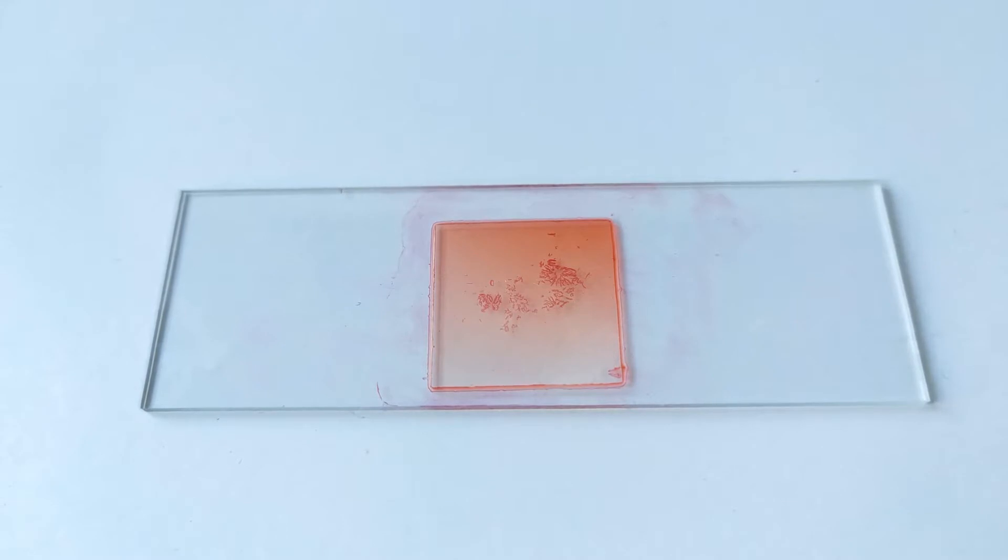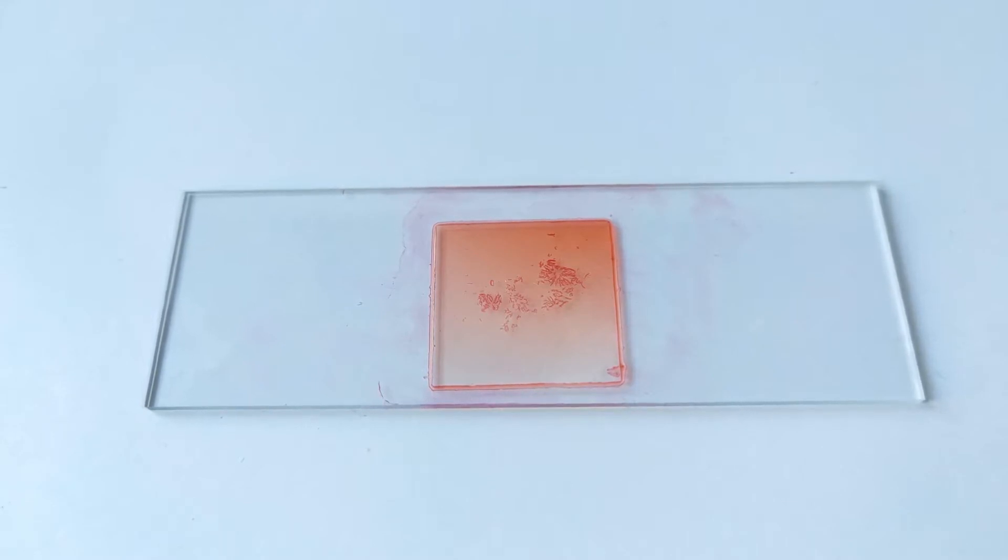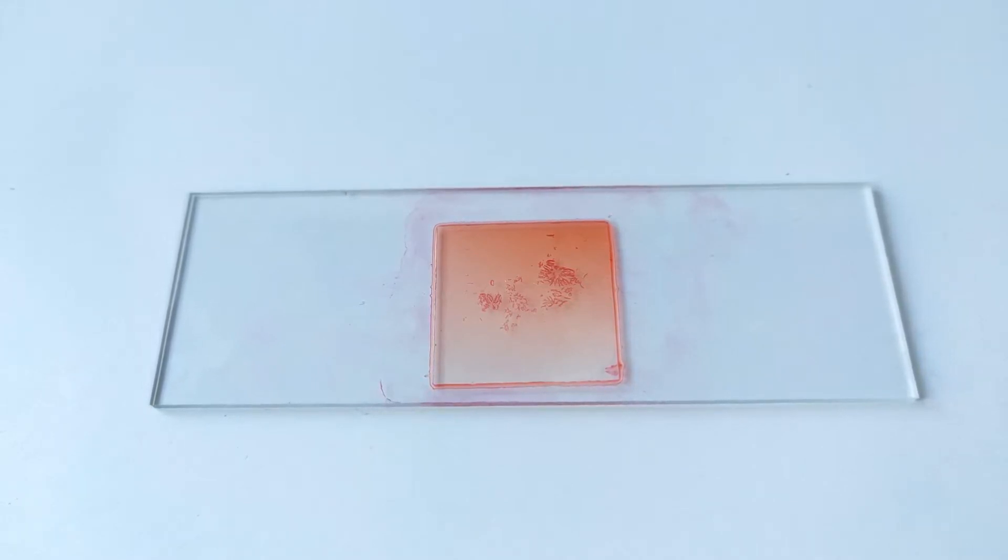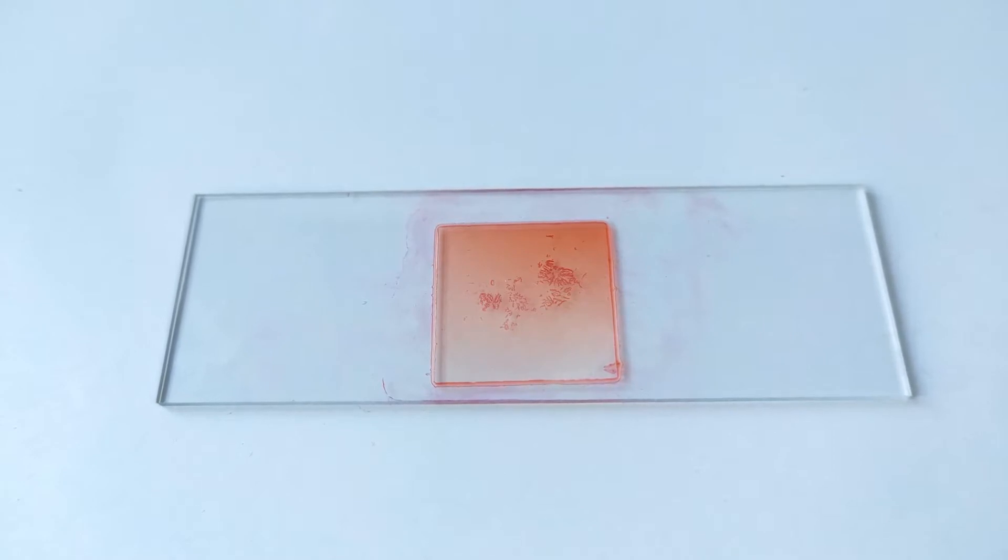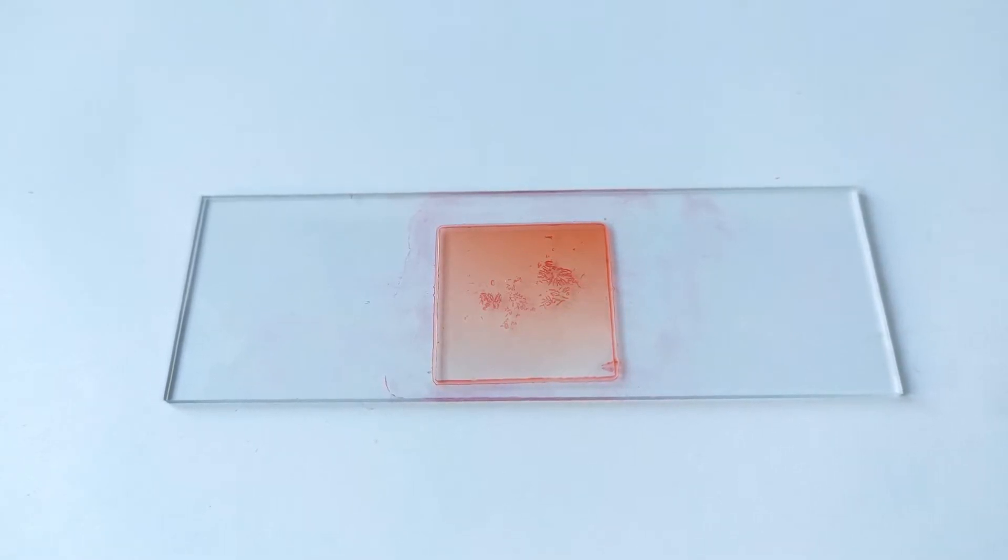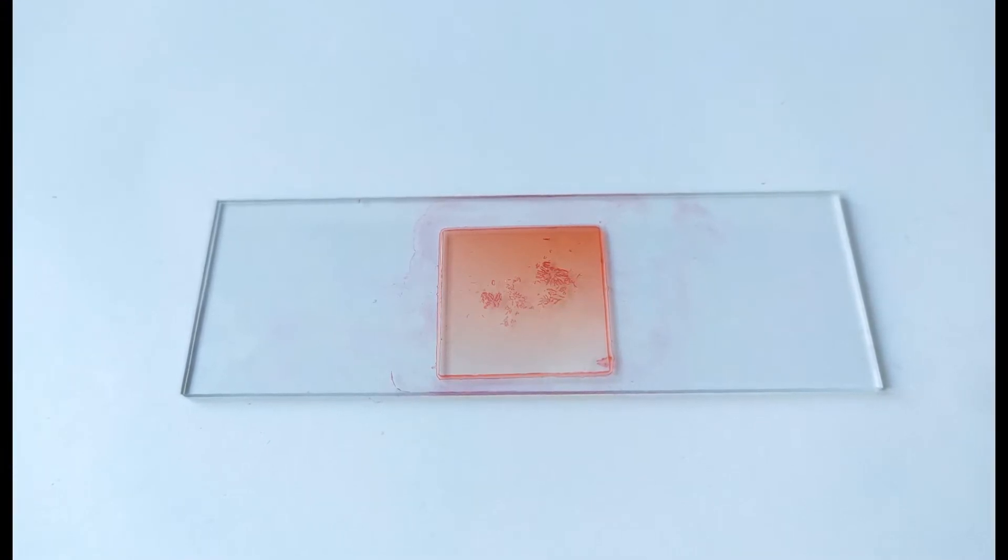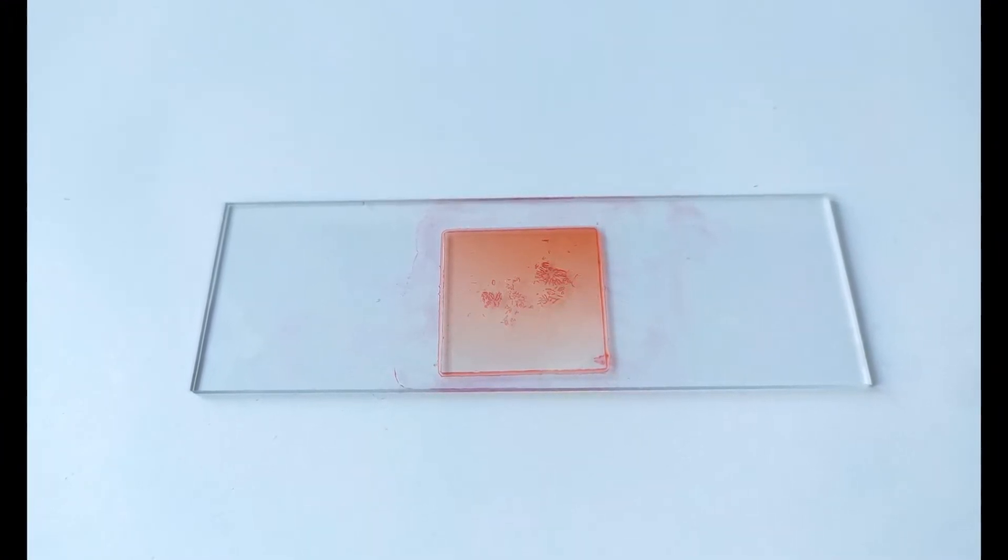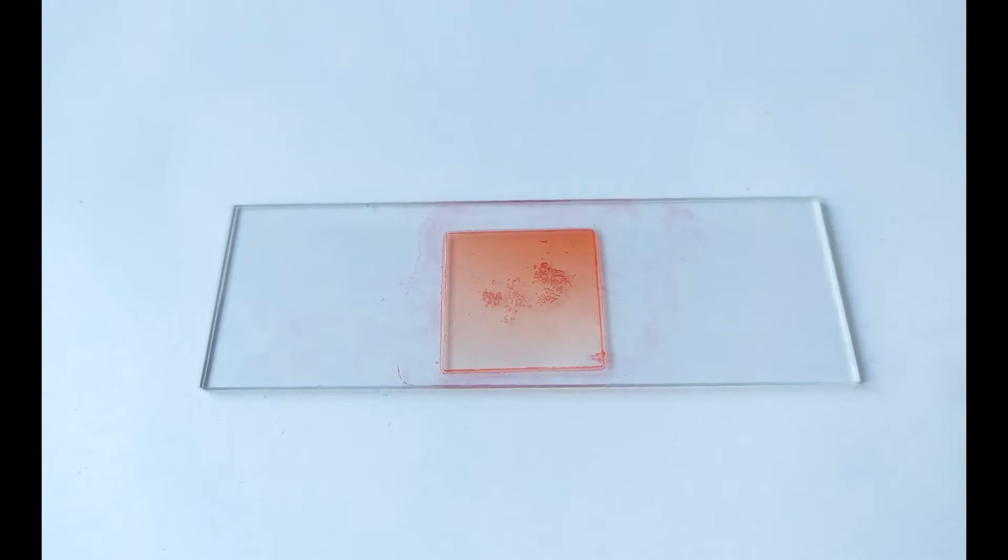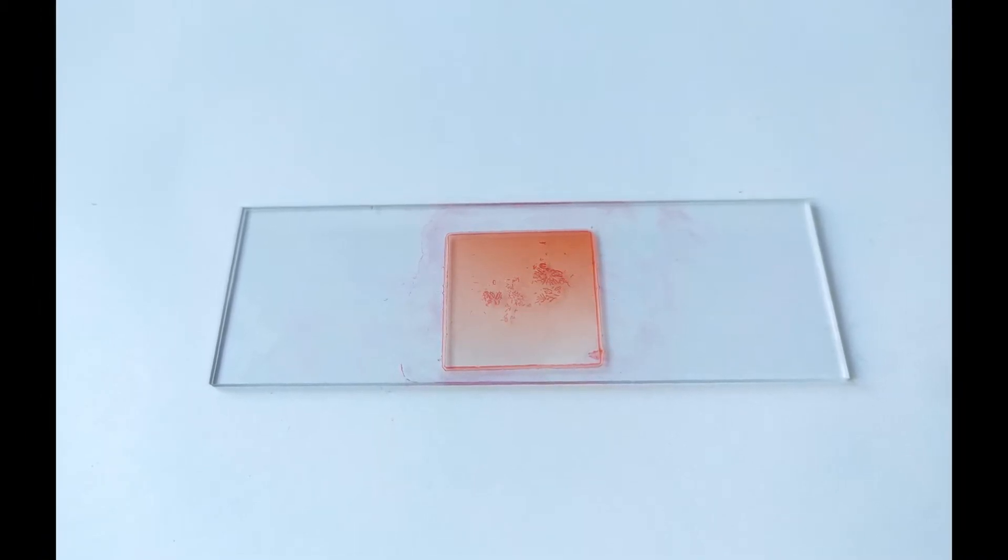This is especially important when you have obtained cells in perfect cell division stages or with perfect well-spread metaphase chromosomes for karyotyping. In this video, I'll be walking you through a simple yet effective way of making permanent slides out of temporary cytological slide preparations.